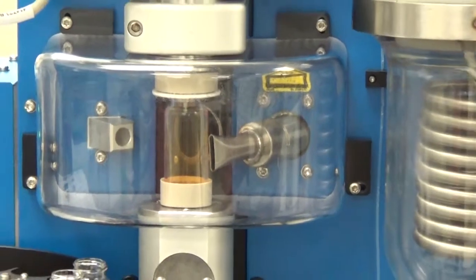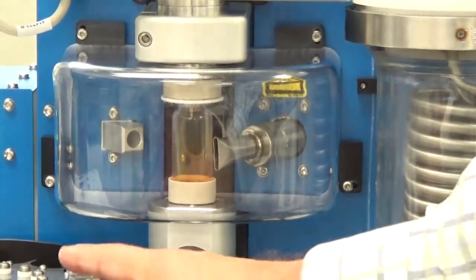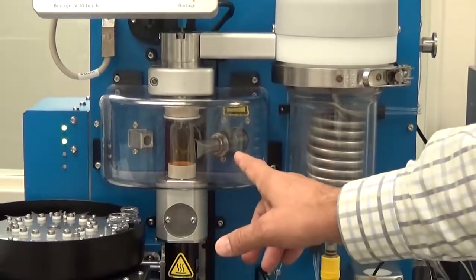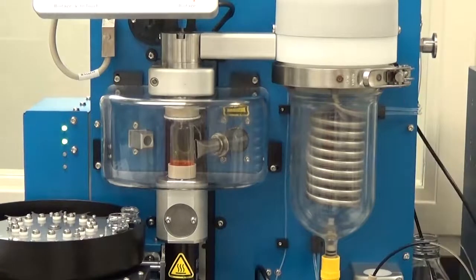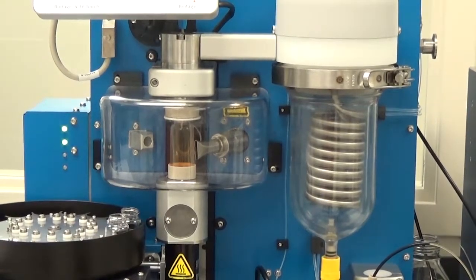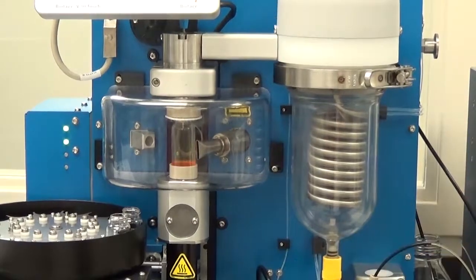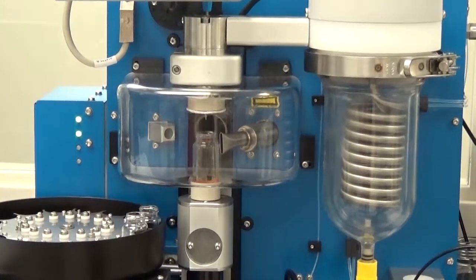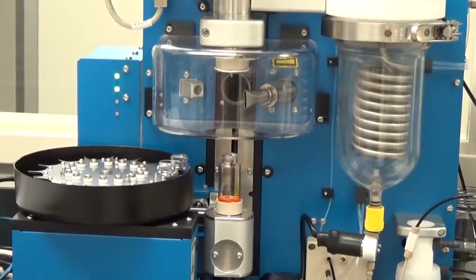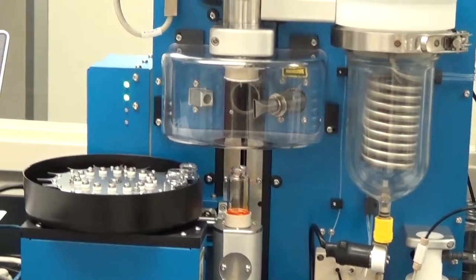This is very nice if you've got a whole bunch of samples that you have dissolved in one solvent and you want to take them on to the next step, whether that's storage or the next step in your reaction in a different solvent, and this will do that all for you completely automatically. So it's unloading the vial now. That's our first vial. And it will go ahead and inject the second vial here.